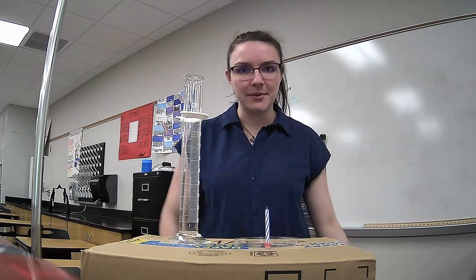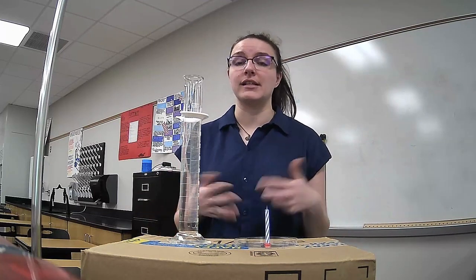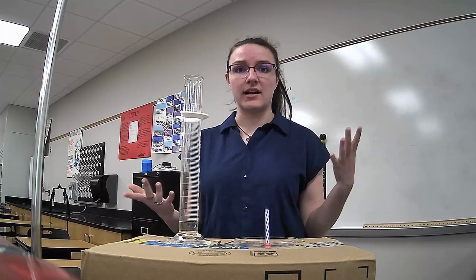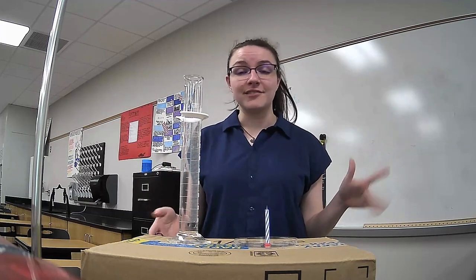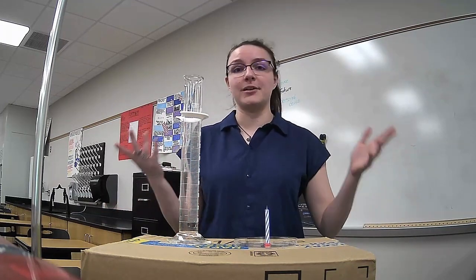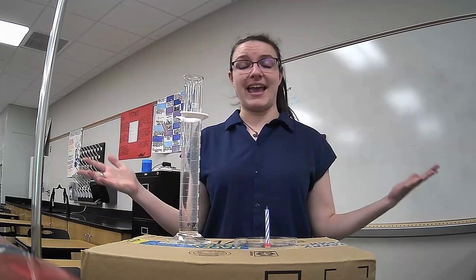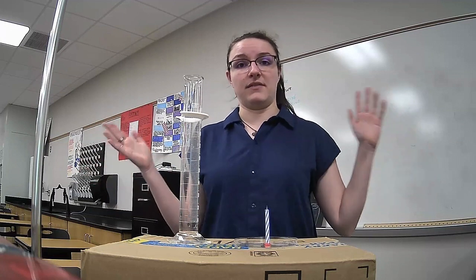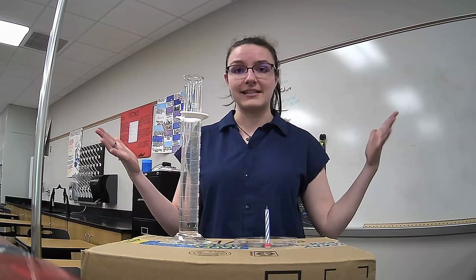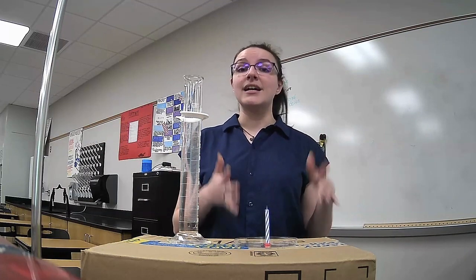Hello, today we're going to be doing an experiment to try to measure how much oxygen is in the atmosphere, how much oxygen is in the air. Believe it or not, air is actually a scientific term that refers to the specific mixture of gases that make up the atmosphere. All of the mixture of gases that we breathe in, that is the definition of air.